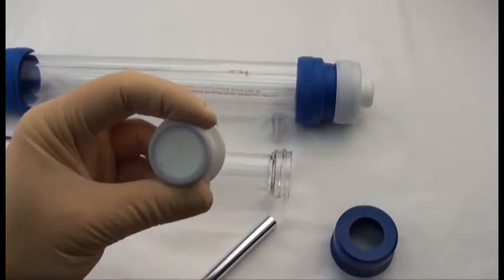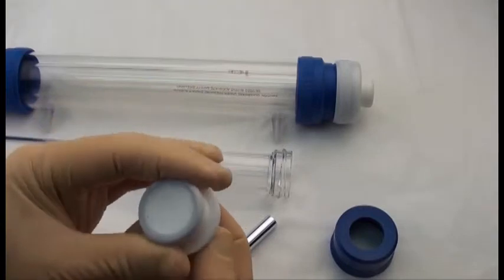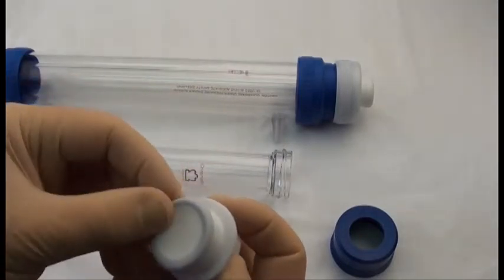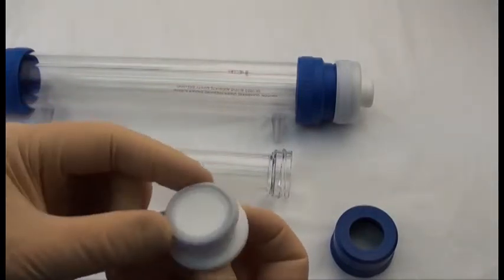And you can see I've marred this one. But using a fresh one, you shouldn't have any gaps, and it should fit snugly into the end fitting.